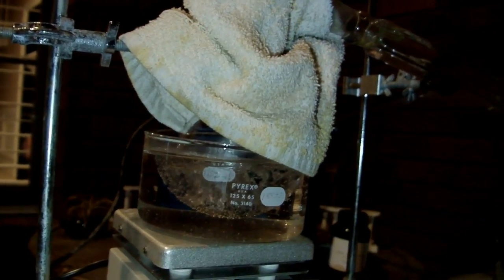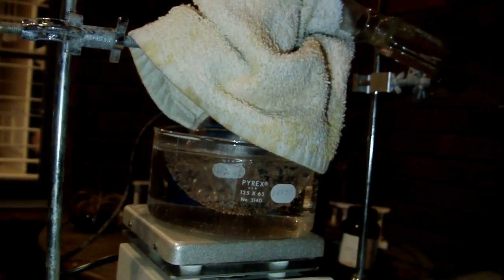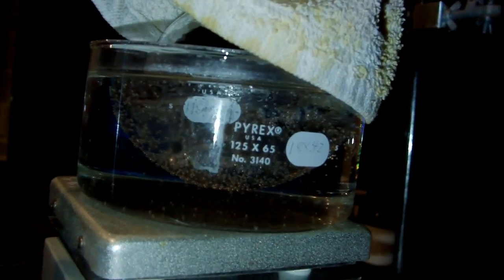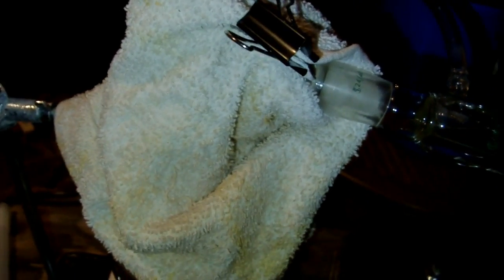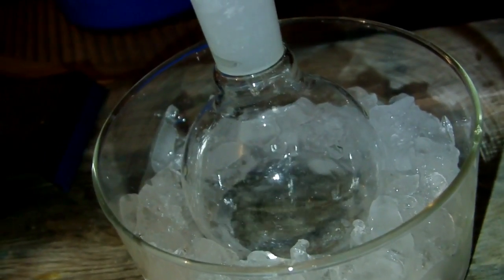It's starting to get dark here now, but I wanted to show you that I improved my system a little bit. We still got a pretty nice boil going on. But what I've done is I've wrapped a cloth around the still head and adapter to keep the heat in. And that's going to more efficiently keep it as vapor in here and only condense in the condenser, which is where I would rather it condense anyways.